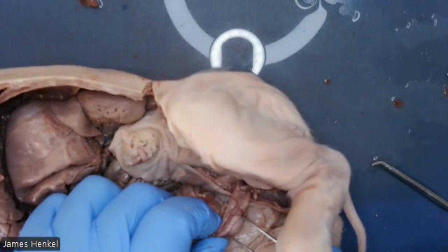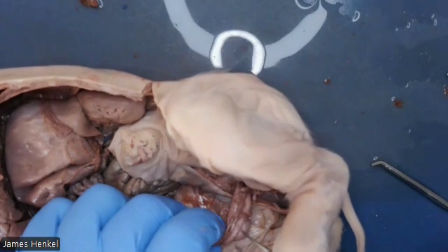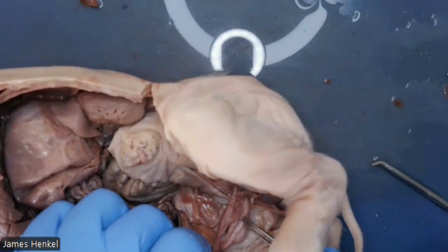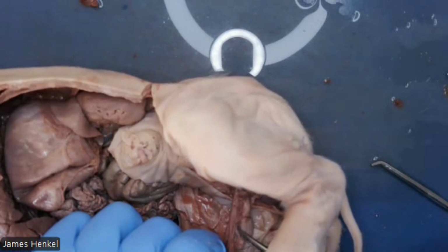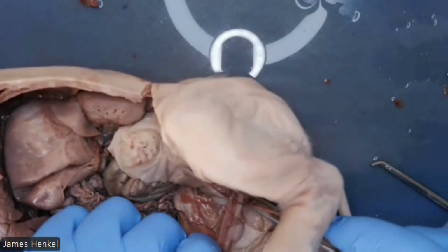There is this half coverage around the circumference of it of this membrane, and that's the epididymis. The epididymis, and that goes around like a scallop or around the scalloping feature around that.